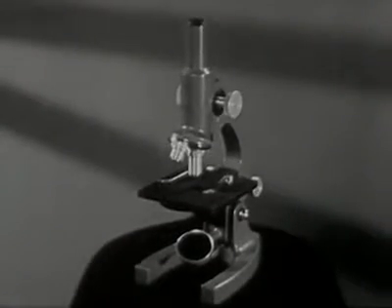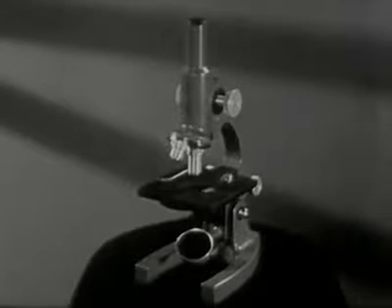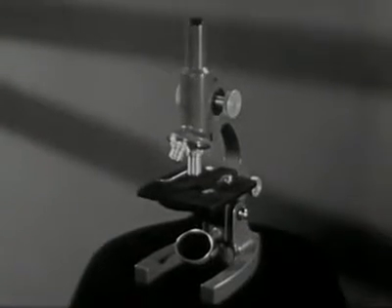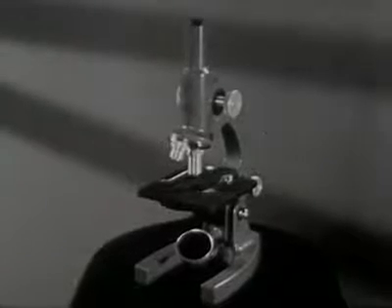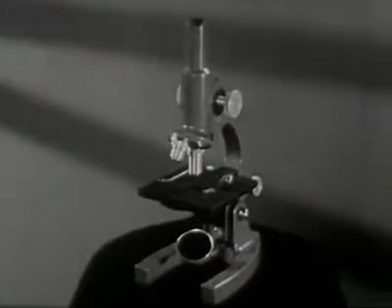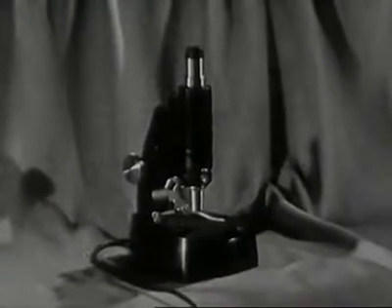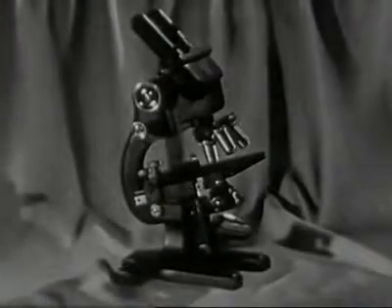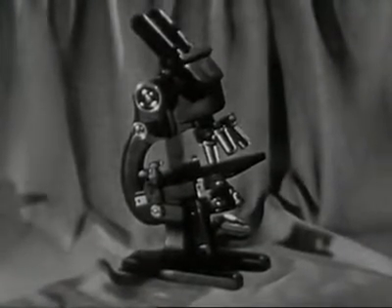The microscope is one of the most useful instruments you'll use in your study of science. It is one of the oldest and most universally used of all optical instruments. And the microscope is just as essential for your work as a student as it is for the work of the trained scientist. There are many types of microscopes, some more elaborate than others, some made for special purposes.